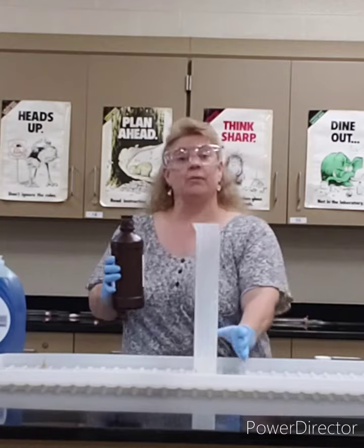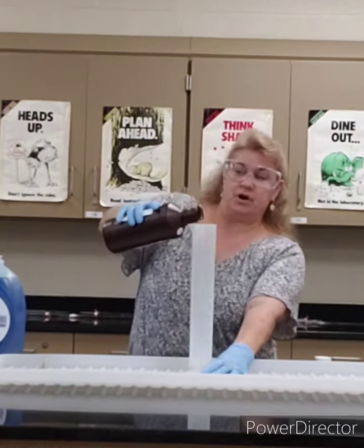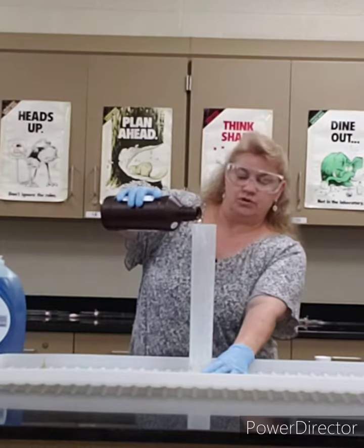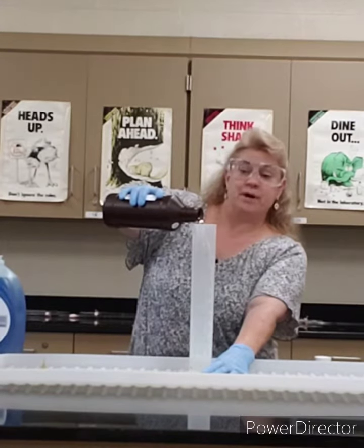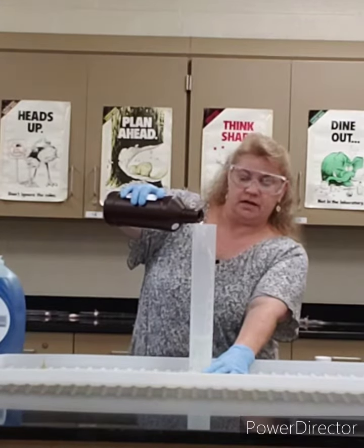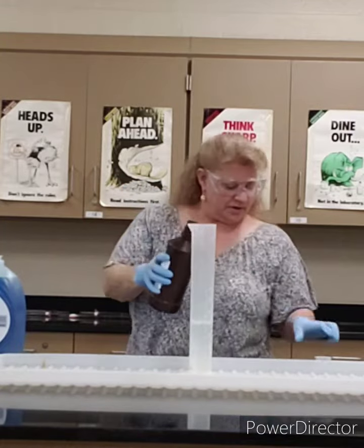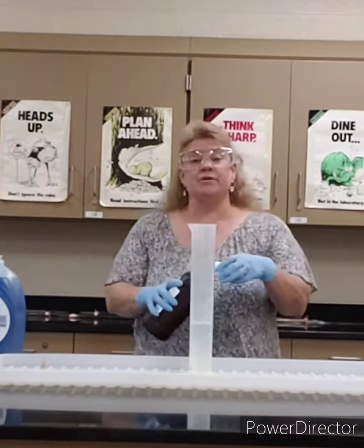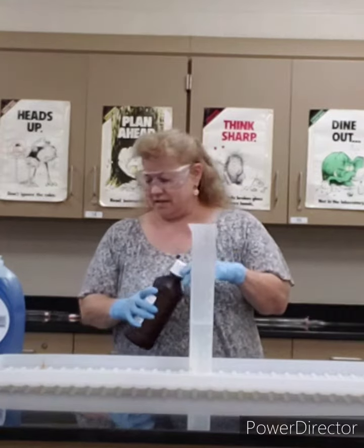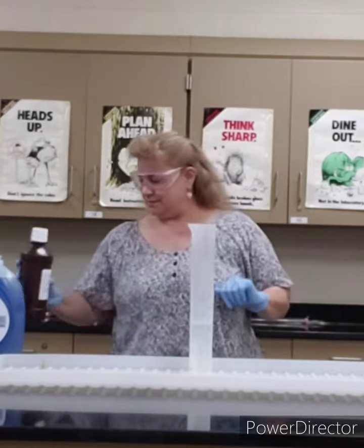This is not regular ordinary drugstore hydrogen peroxide. Drugstore hydrogen peroxide is about 3% hydrogen peroxide and 97% water, but this hydrogen peroxide is 30% and it would burn you. That's why I'm wearing gloves.